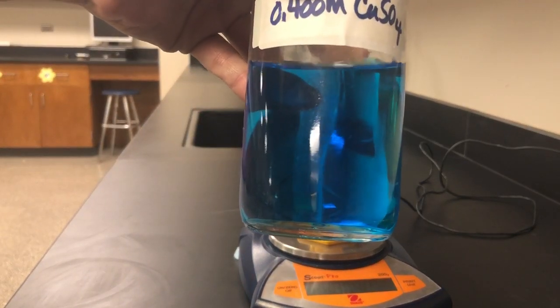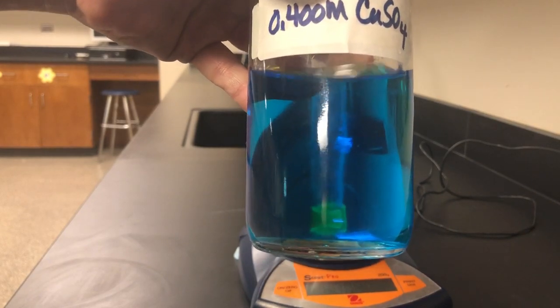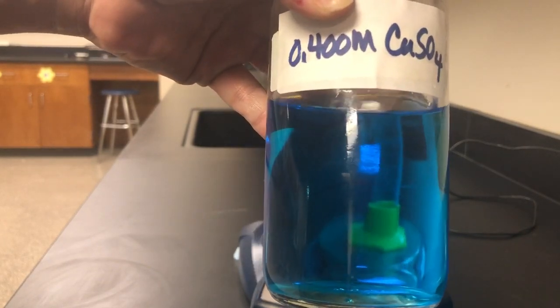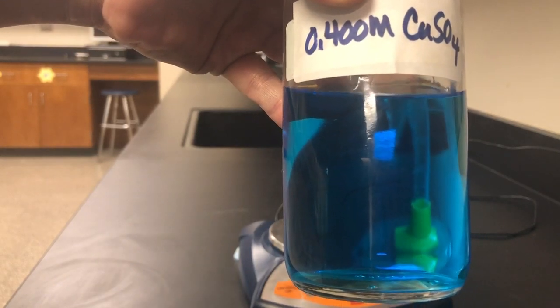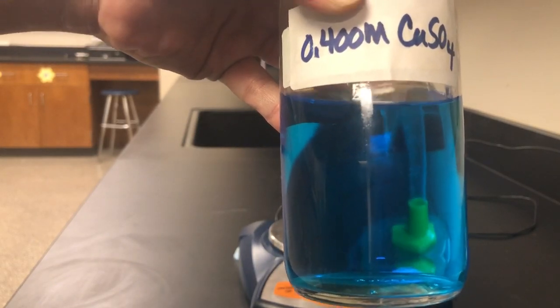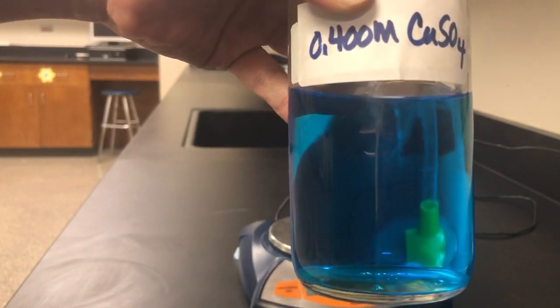Aqueous means that the salt is dissolved in the water. If you look at the solution, you can see through it. So I would definitely classify this as a transparent solution, and I can tell that it is blue in color.